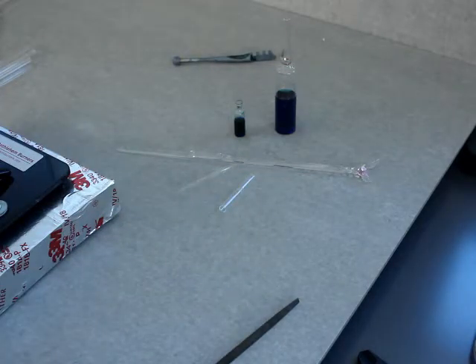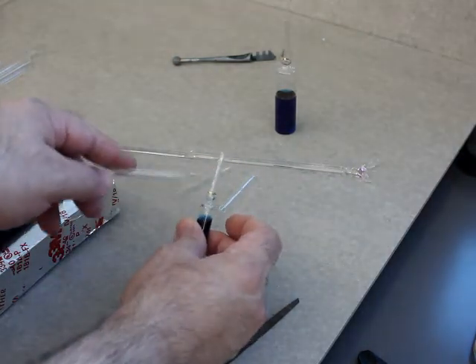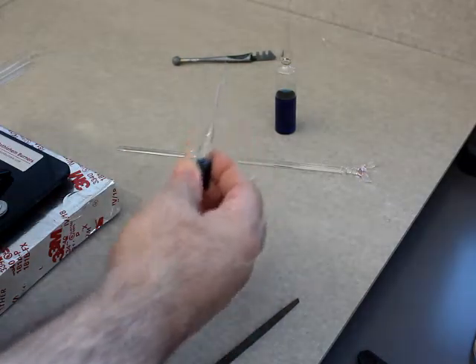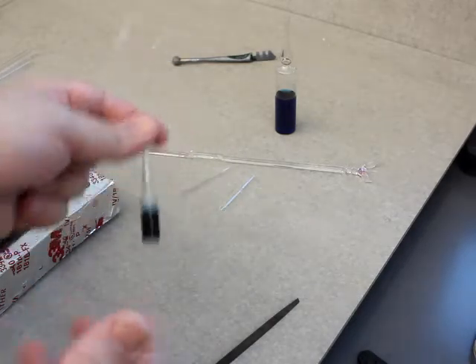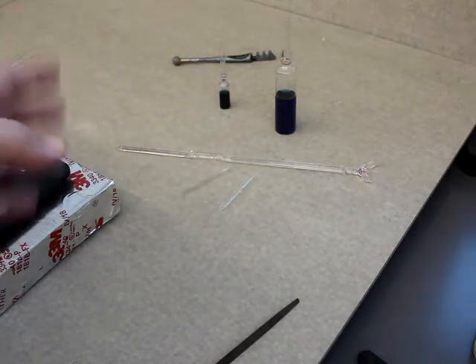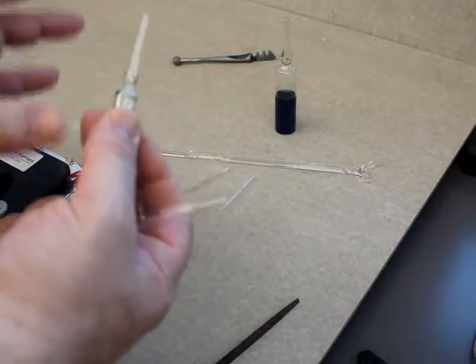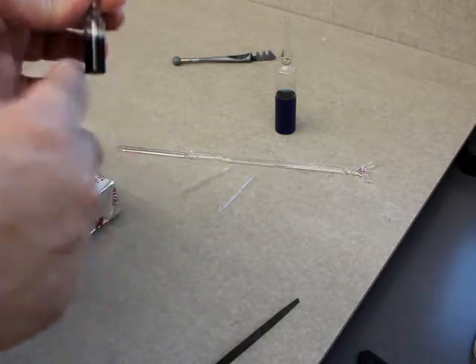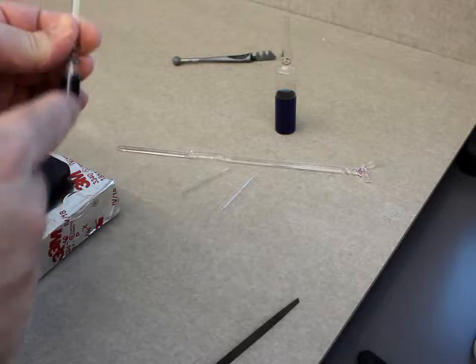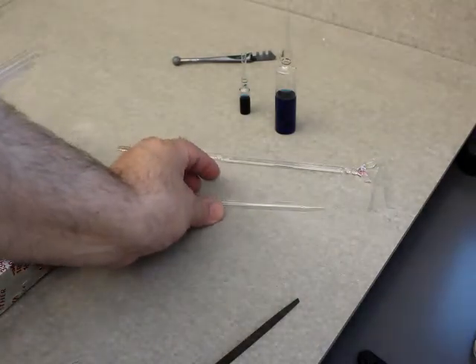In my case, it was both about the mechanics and making sure I could do it in one try, because the vial of deuterated acetonitrile was the only one we had and that stuff is expensive. These are my sample vials — this is just food coloring, by the way, just to make it show up better. The reason why that deuterated acetonitrile was in an ampule and expensive is because it was anhydrous — it had been distilled to remove all the water and oxygen, and so it was sealed under vacuum inside that ampule. When I opened it in the glove box, it was going to be very pure — no water or oxygen in the sample — and for the research I was doing at the time, that was absolutely critical.